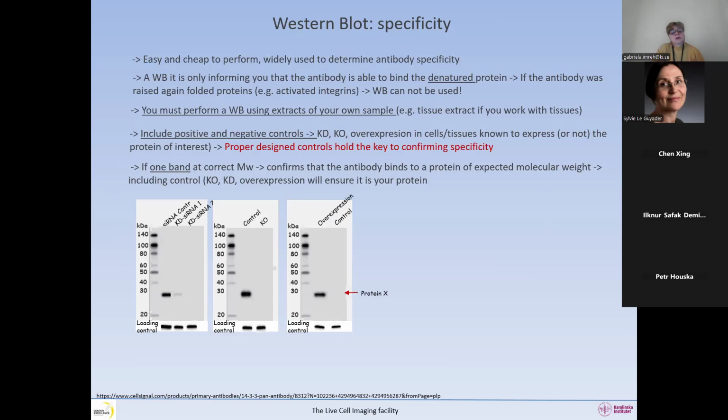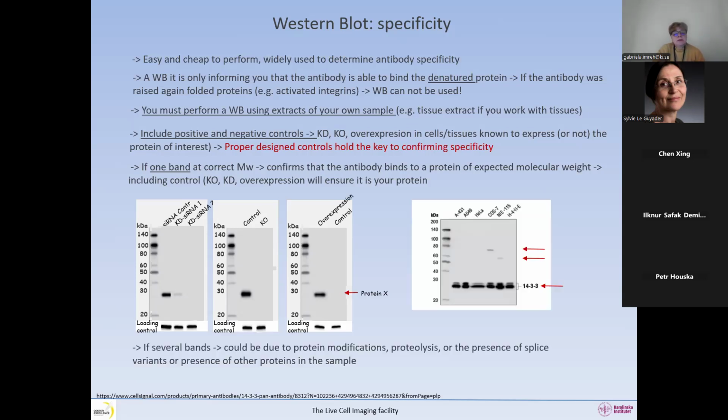So when you run a Western blot, you are expected to get one band at the correct molecular weight, which will confirm that the antibody binds to the protein of the expected molecular weight. But without controls, you will never be sure. Sometimes you can also get several bands, and this is due to protein modification, proteolysis, or the presence of splice variants, but it can also show non-specificity of your antibody, like for example in this blot, where you can see that in two different cell lines you have some extra bands that should not be there.